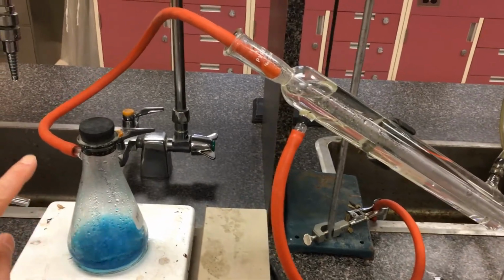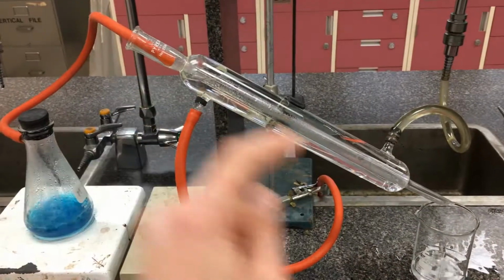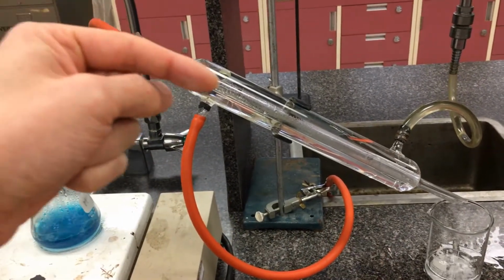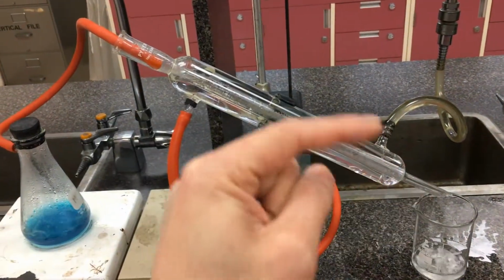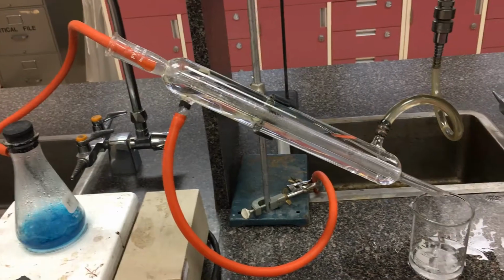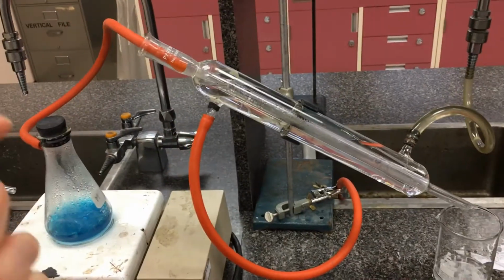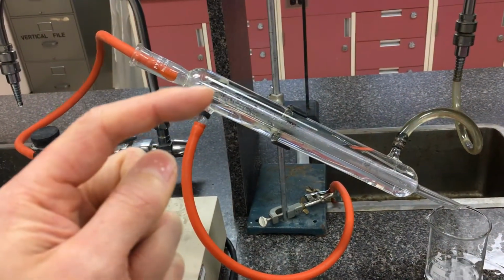That aldehyde is going to travel up this rubber hose here. Again, it's going to encounter this really cold environment of the water condenser here. The central chamber here is like a tunnel. That part there is unconnected to this outer condenser wall here. The condenser we just fill in with cold water just to provide a cold environment, so that as the aldehyde vapor makes its way to the top here, it recondenses into a liquid.